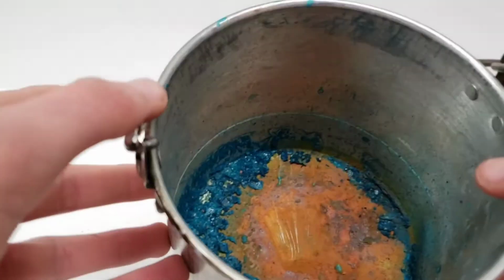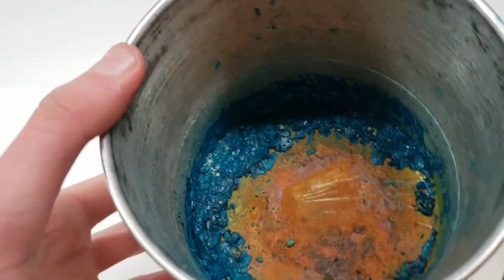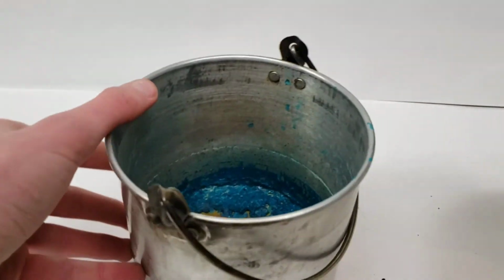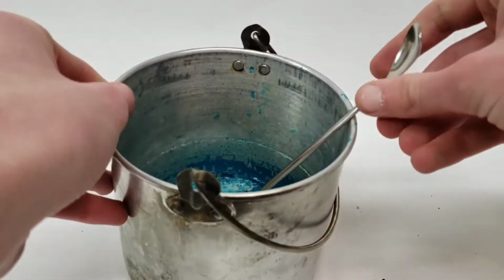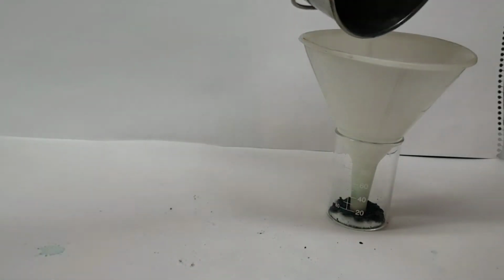And so the remaining copper acetate, I think, actually looked pretty interesting, but it had still kind of gone to waste. I scraped it out of the pot, but I was just left with this complete mess of copper acetate along with copper and aluminum acetate, and I didn't really think there was anything I could do to separate it apart. Because even though the copper isn't soluble in water, and the acetates are, so I could separate those pretty easily, I really don't think there's any way that I could have separated the acetates, at least nothing that I could do at home, because I really didn't have access to that much, and really don't much now either.